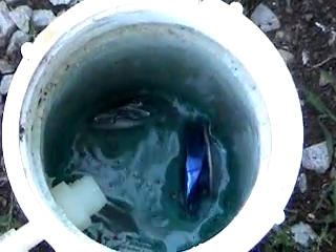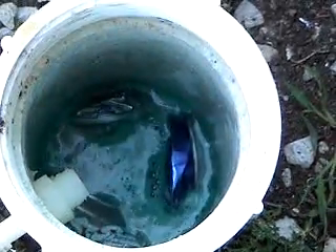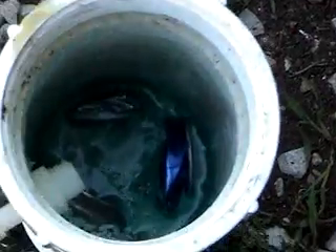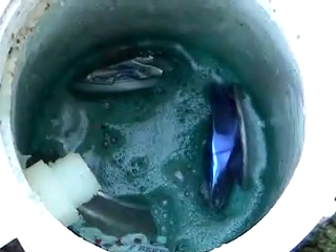Not a lot going on yet — it's just starting to fizz. Can you see the vapors coming up through there? It's starting to bubble. It took a few minutes the other day to get it going, but once it got going it was bubbling real good.